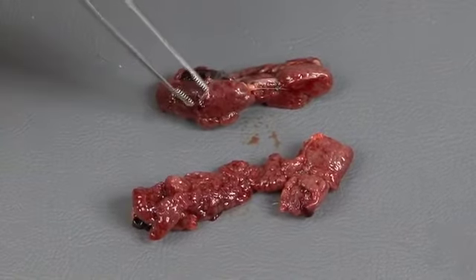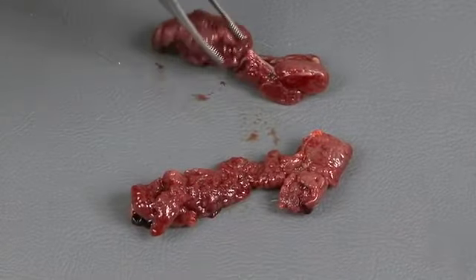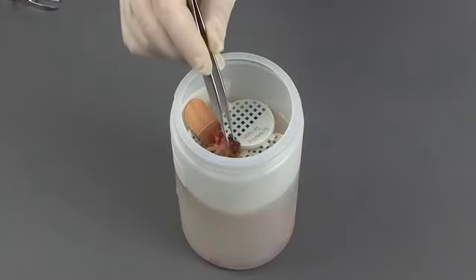Section and examine all the lobes of the kidneys. The cut surfaces should have a fine lobular pattern. Look for excessive amounts of urates or other abnormalities. Take a section from each kidney, along with any lesions, and place them in formalin.